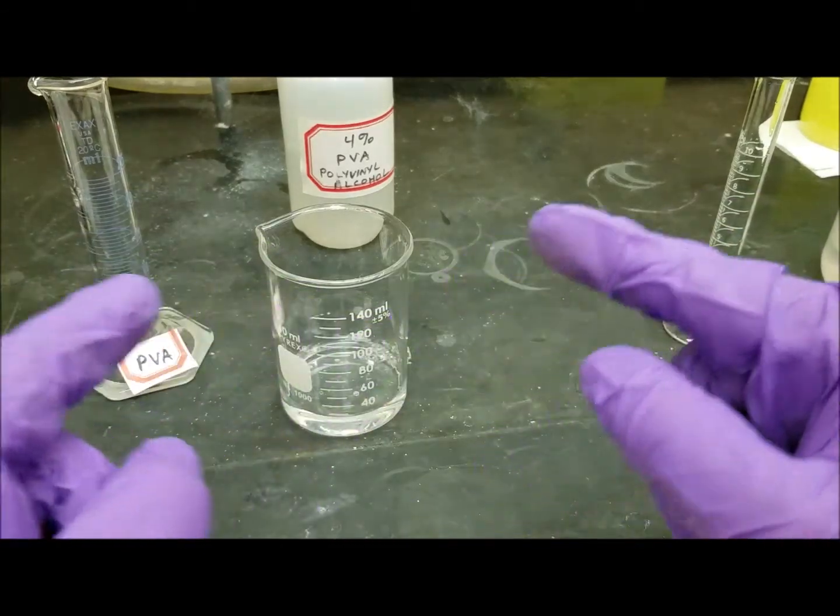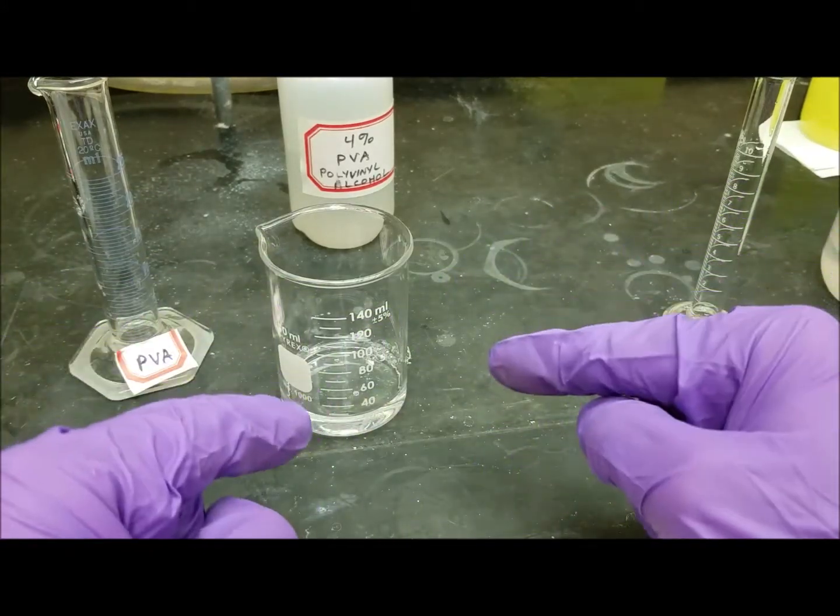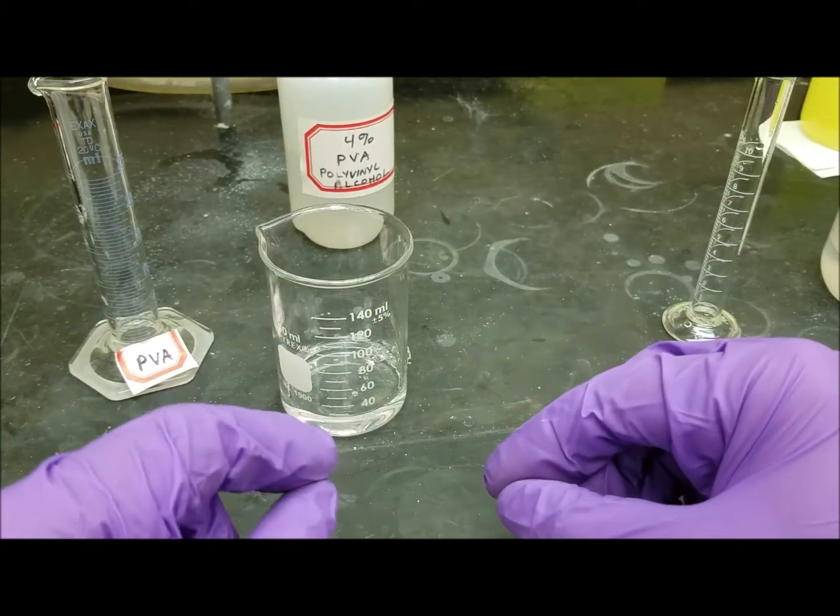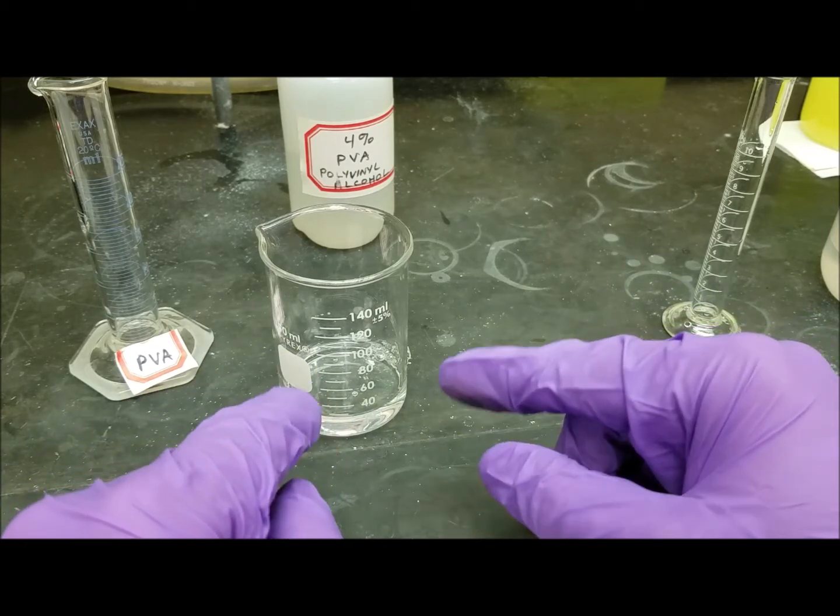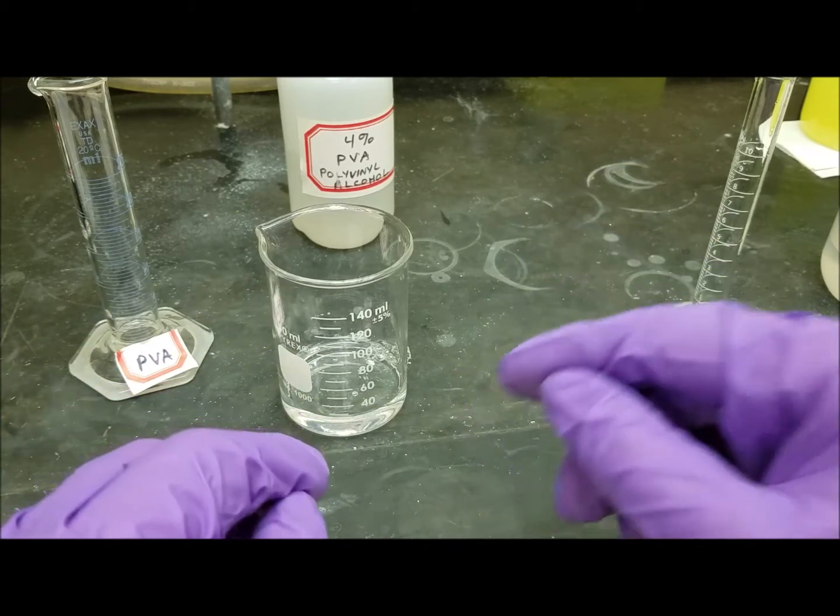So this is just, there are a bunch of long, really long chains in there that have OH groups, alcohol groups coming off of them.